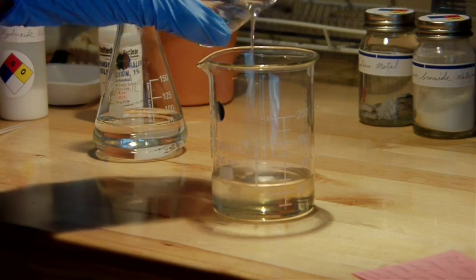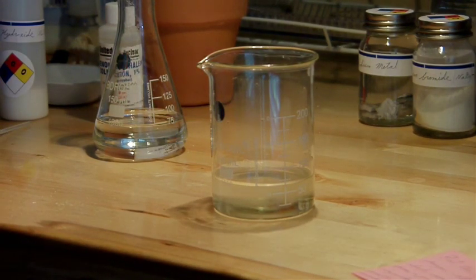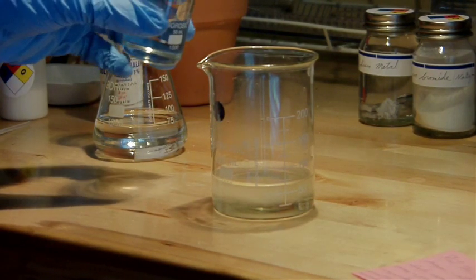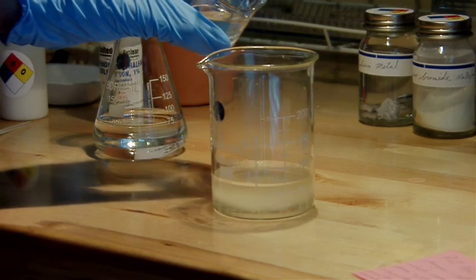You still want to add it fairly slowly though, because this reaction generates heat. Which the camera might not be able to pick up, but you can see there's actually some steam coming off of this.